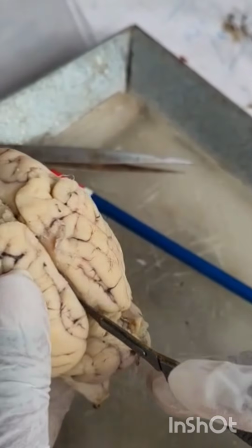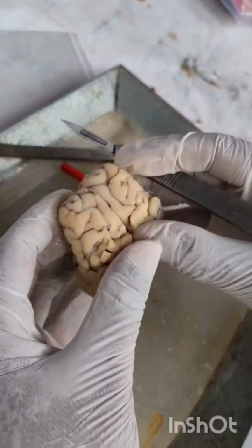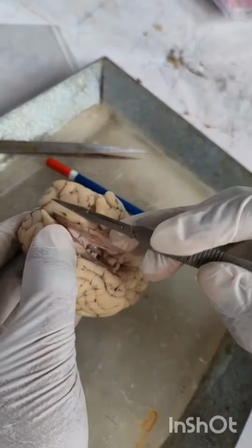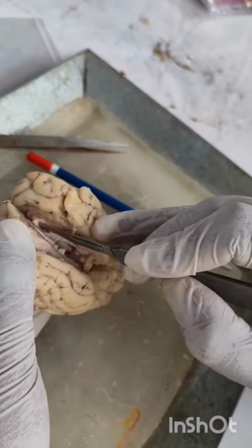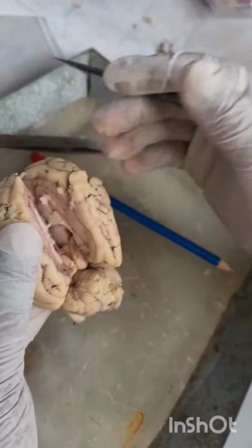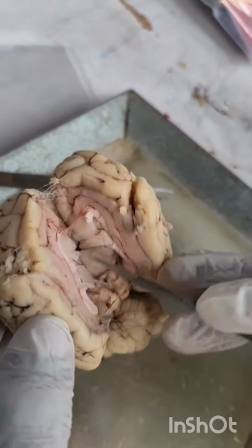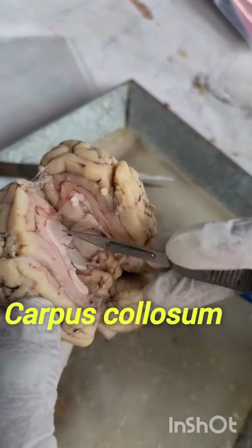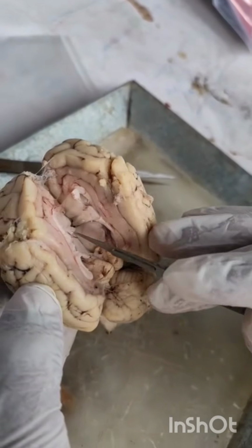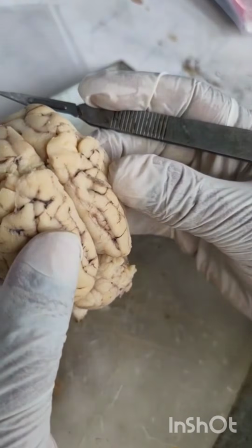Now I am cutting the cerebrum into 2 hemispheres. See here, you are going to observe after cutting a white colored tissue. This white colored tissue is called corpus callosum. This corpus callosum connects the 2 hemispheres into 1, like this.